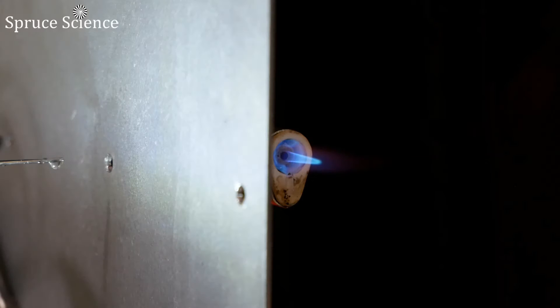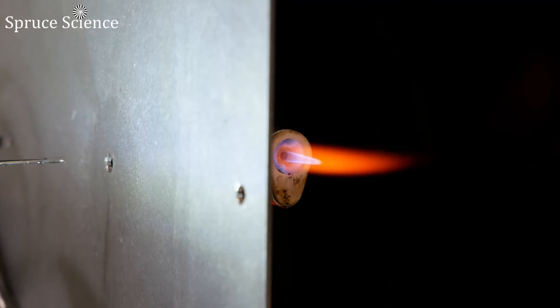Here's a more direct view of the flame, so you can clearly see the change in color. When I turn on the high voltage power supply, sample ions are delivered to the flame and you can immediately see the change in color.